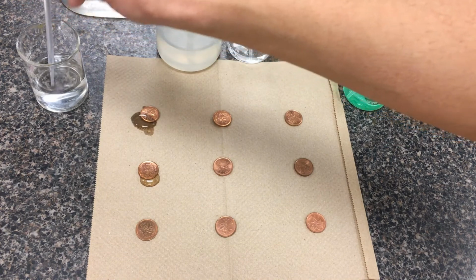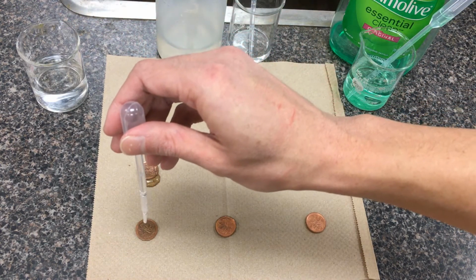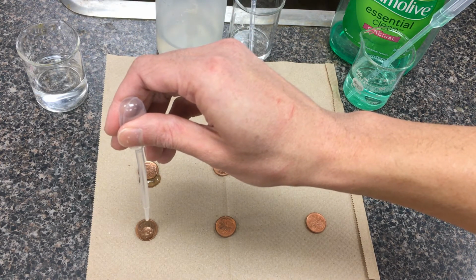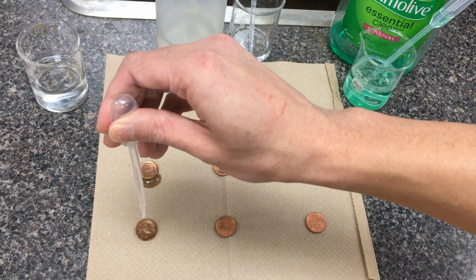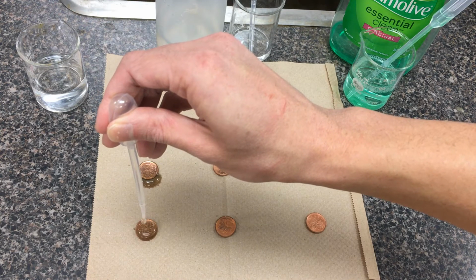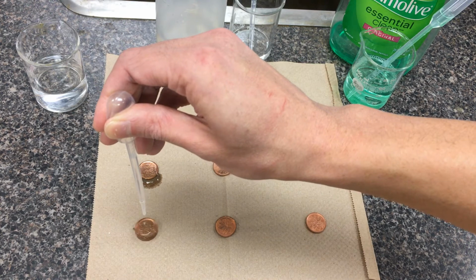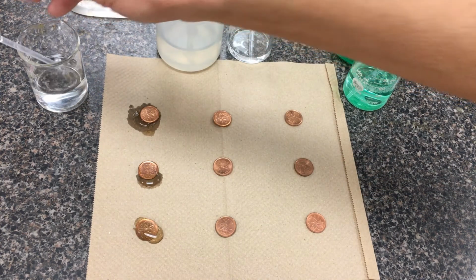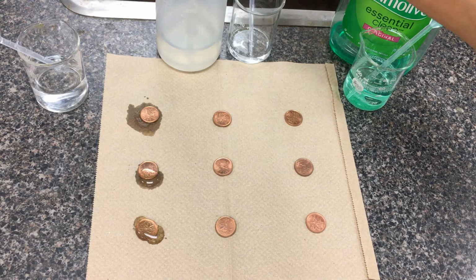One last trial here. You'll notice that the pennies are all leaf side up, so I wanted to control the surface area a bit here. So 1, 2, 3, ... 24, 25, 26, about maybe 26 there. Okay, so those are the 3 trials. If the variability between trials was very wide, I might go and do a 4th trial or a 5th trial. Let's move on to the methanol solution.